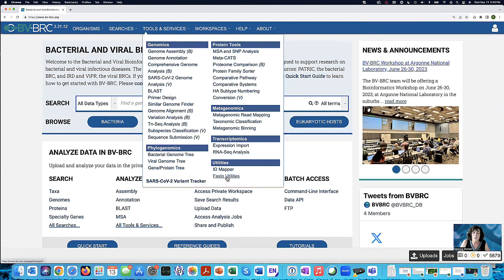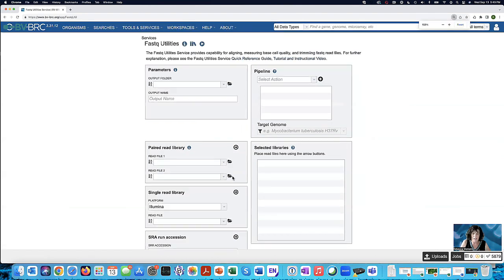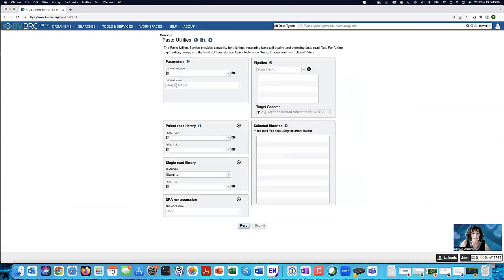But today, we're doing something to look at read quality. And to look at read quality, you need to go here under Utilities and click on FastQ Utilities. So we click on that. And this takes us to the landing page for that particular service. And you can see that there are parameters that they want you to do. There are pipelines. And if I click here, I can see there's a pipeline to trim. There's that FastQC. And there's also a pipeline that will align your reads to a reference genome if you're interested in that. But they accept paired reads, single reads, and those single reads could be Illumina, PacBio, or Nanopore.